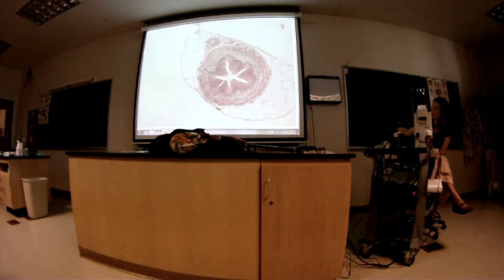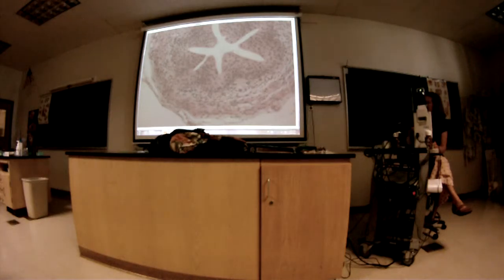Okay, so transitional is here, and then it has the underlying lamina propria, I see you added it, good. That's areolar tissue, just like always. I didn't put areolar tissue on your list, but you should know it for lecture purposes. And then what kind of tissue is this muscle layer? Smooth muscle. The adventitia.